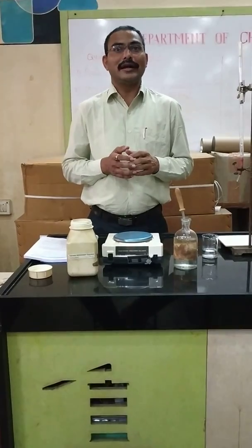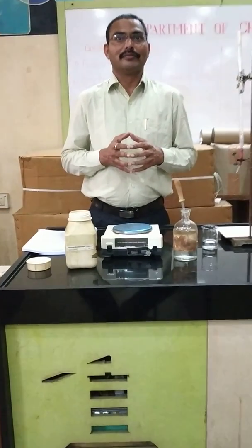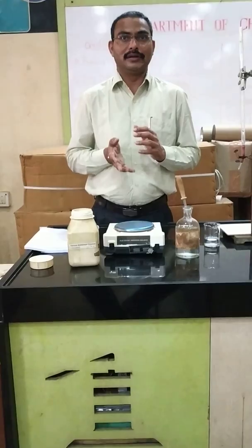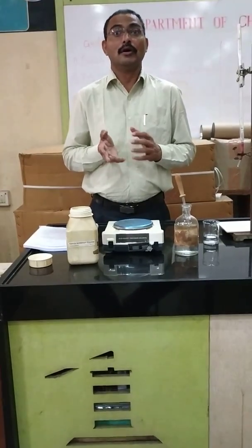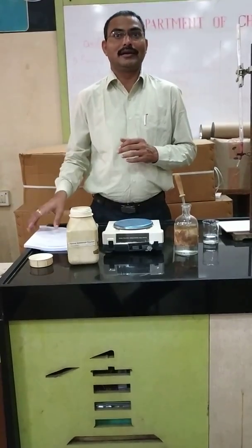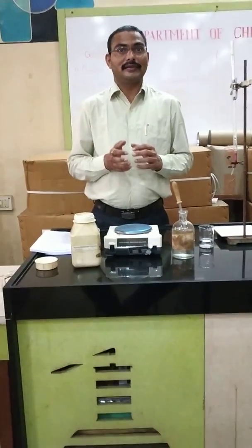You know that there are different types of titration — that is redox titration, complexometric titration, acid-base titration, potentiometric titration, etc.